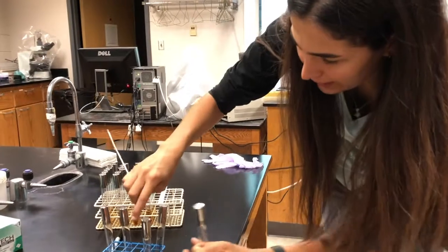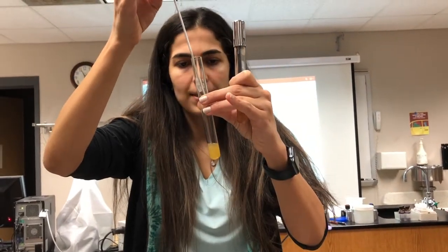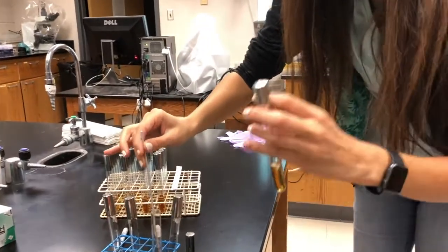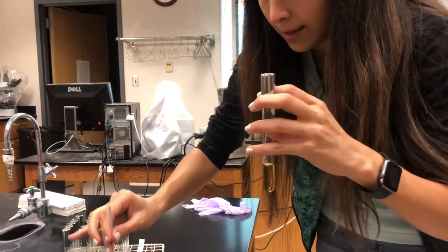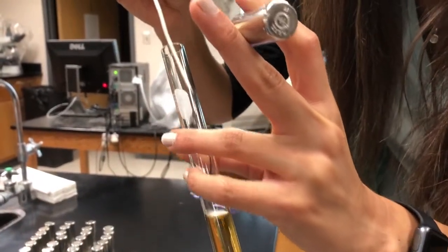Then you need to open the E. coli, which is provided by our lab manager. Grab some inoculum from it, and then do the inoculation, which means transferring to a new environment where the bacteria can grow. That's it.